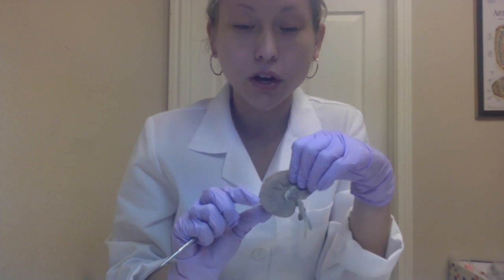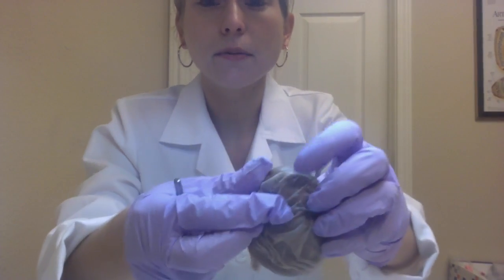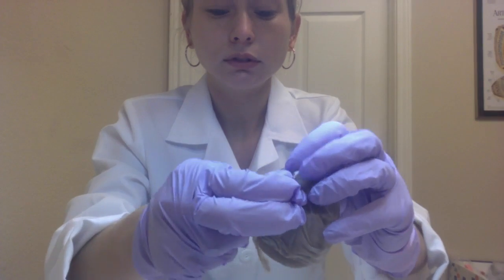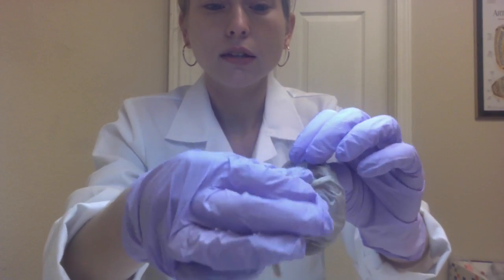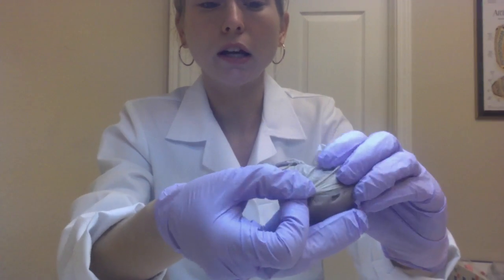This is my sheep kidney anatomical structure identification video. To start, this is the fibrous capsule that covers the kidney.